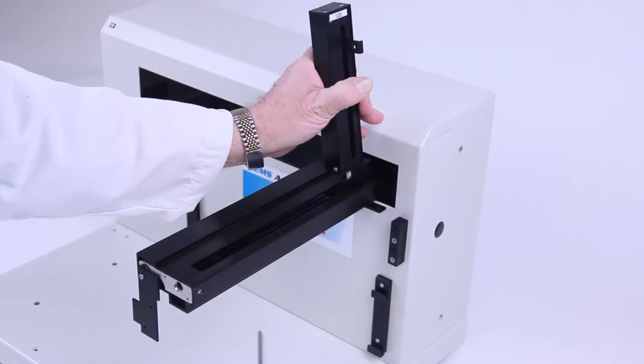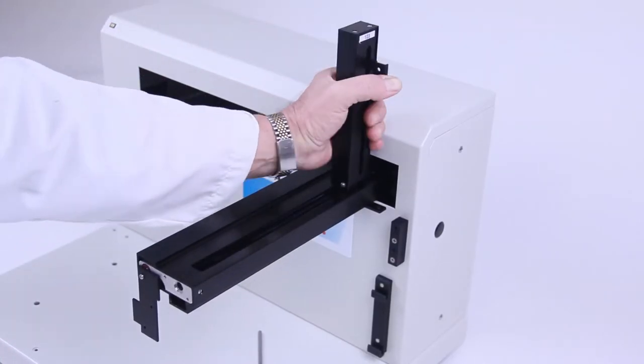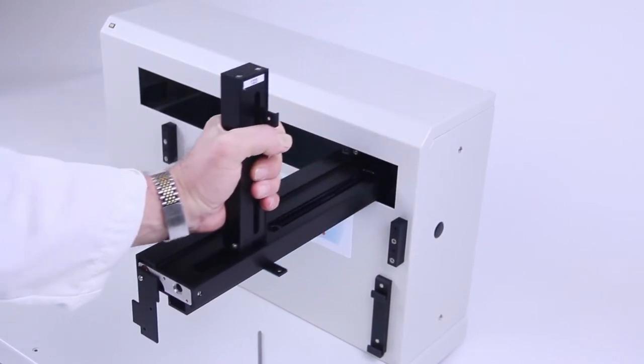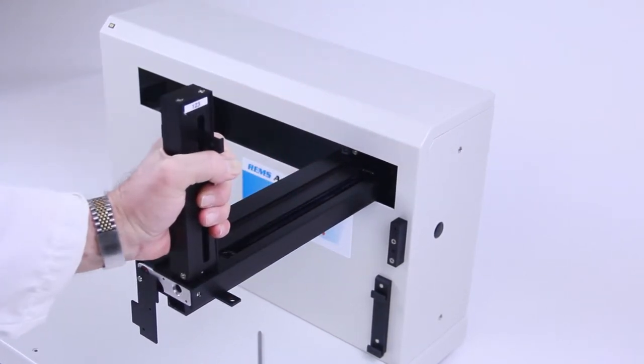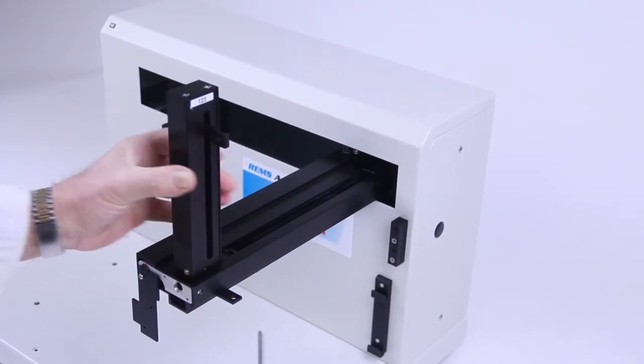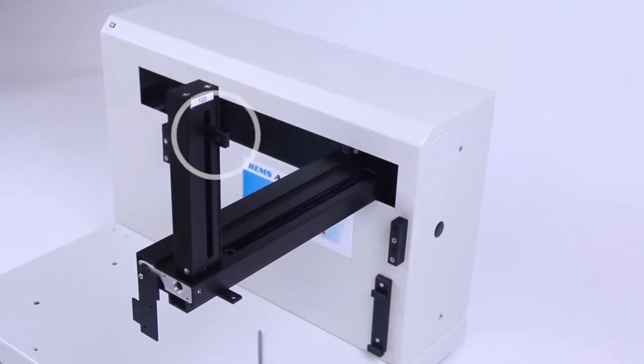Position the vertical arm onto the horizontal slider and pull it all the way forward. The vertical arm's electrode holder bracket should be on your right.